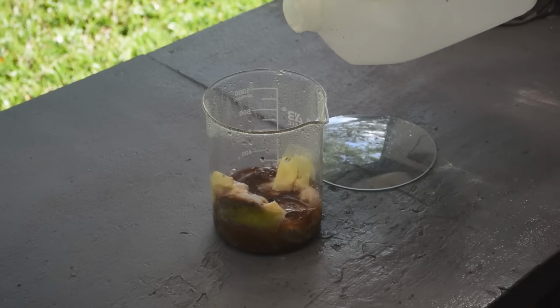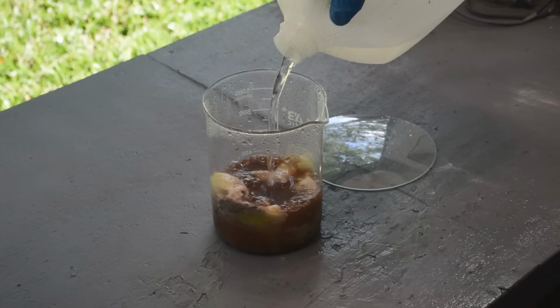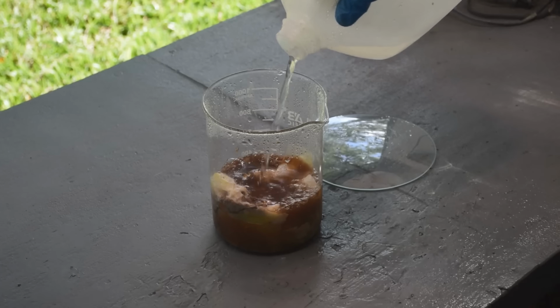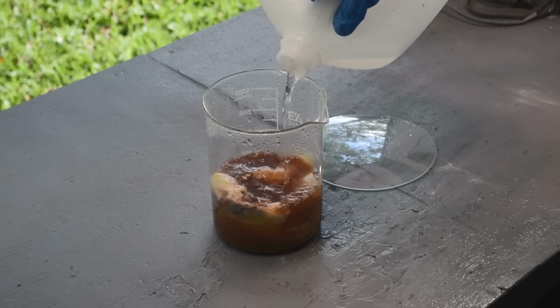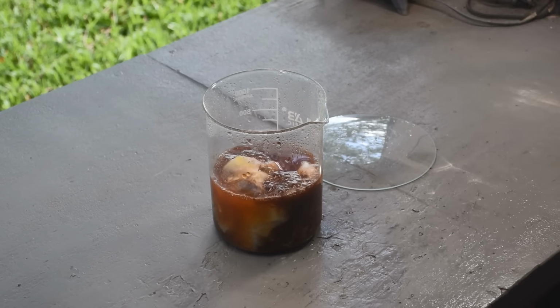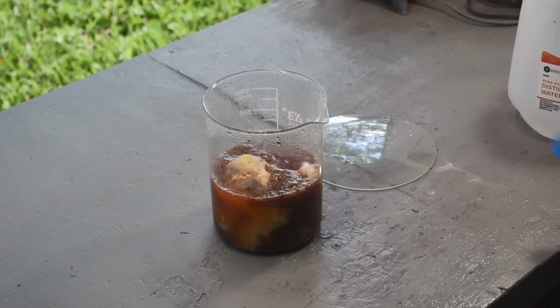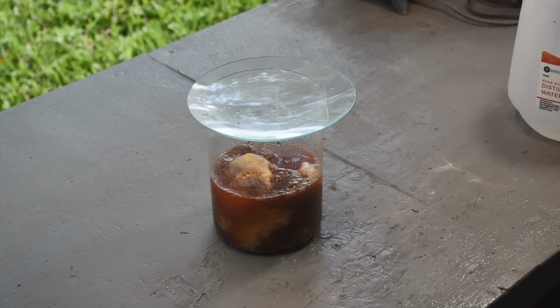And yeah, look at that. Immediately, the red stuff looks like it's going back into solution. I'm going to put about 400 milliliters. Actually, you know what? I'm going to make it a whole half a liter. Why not? Make sure we got enough water in there to do the job. Yeah, look at the deep red color it's taken on. That stuff is going back into solution before our very eyes.